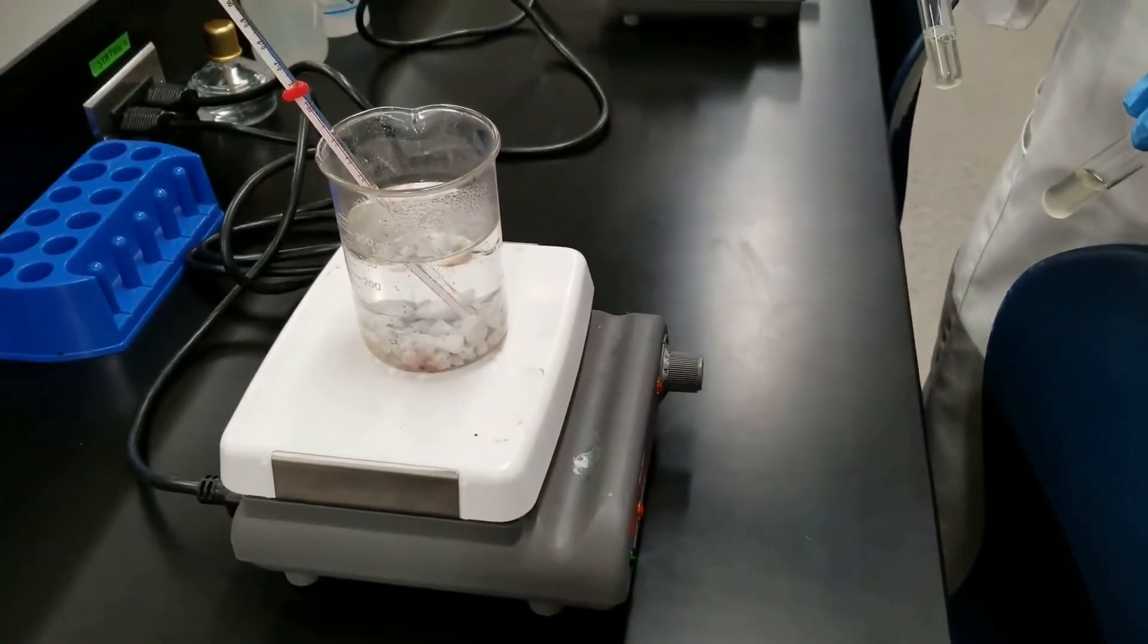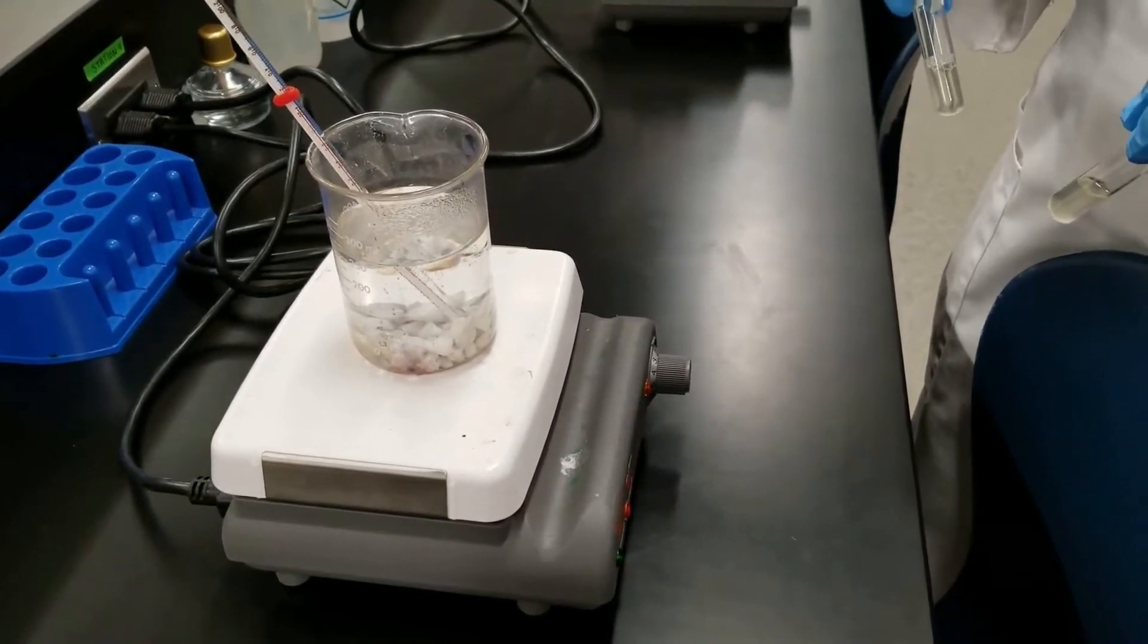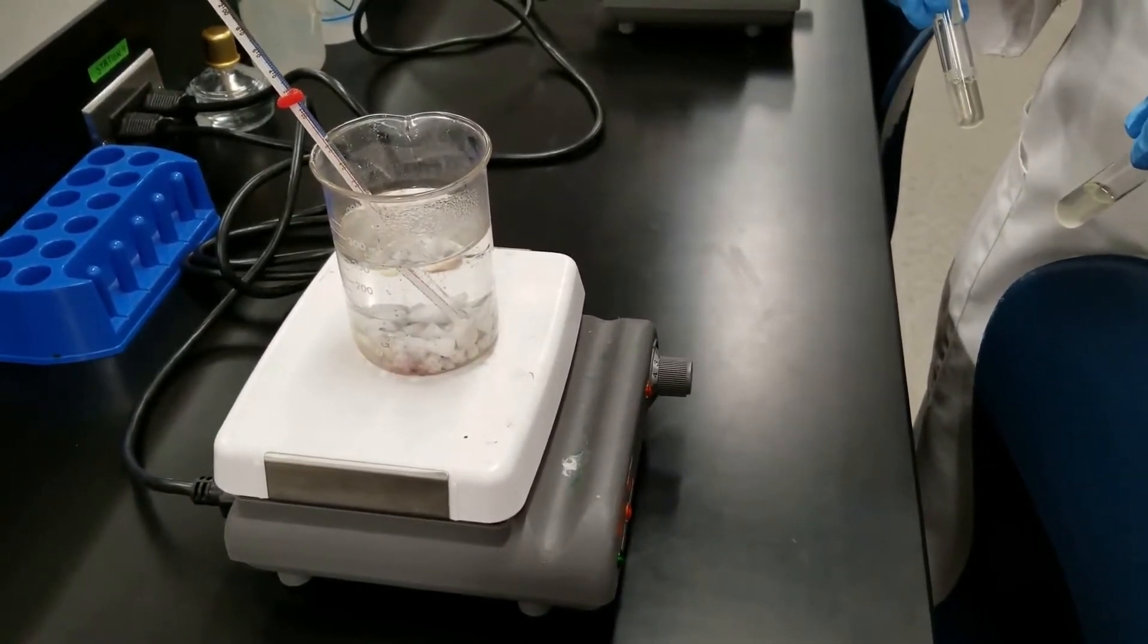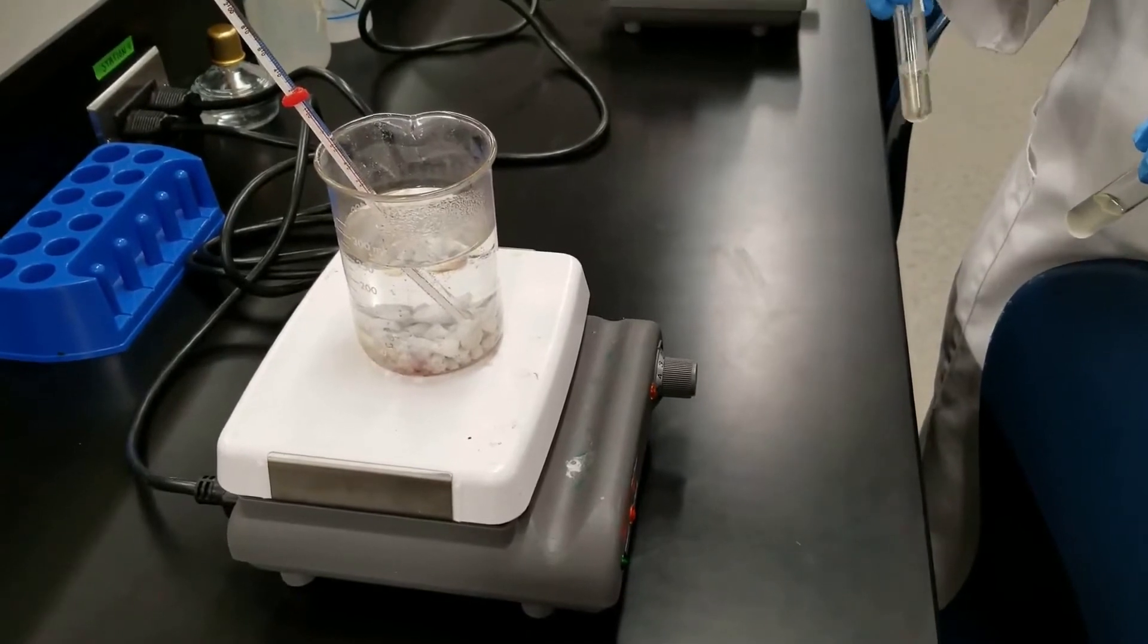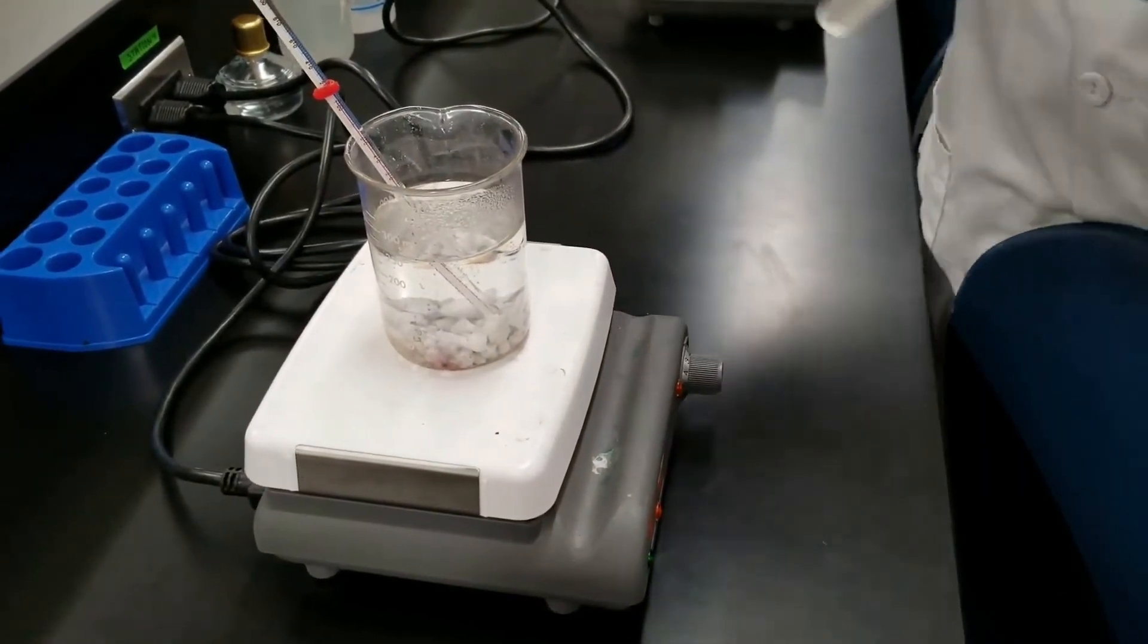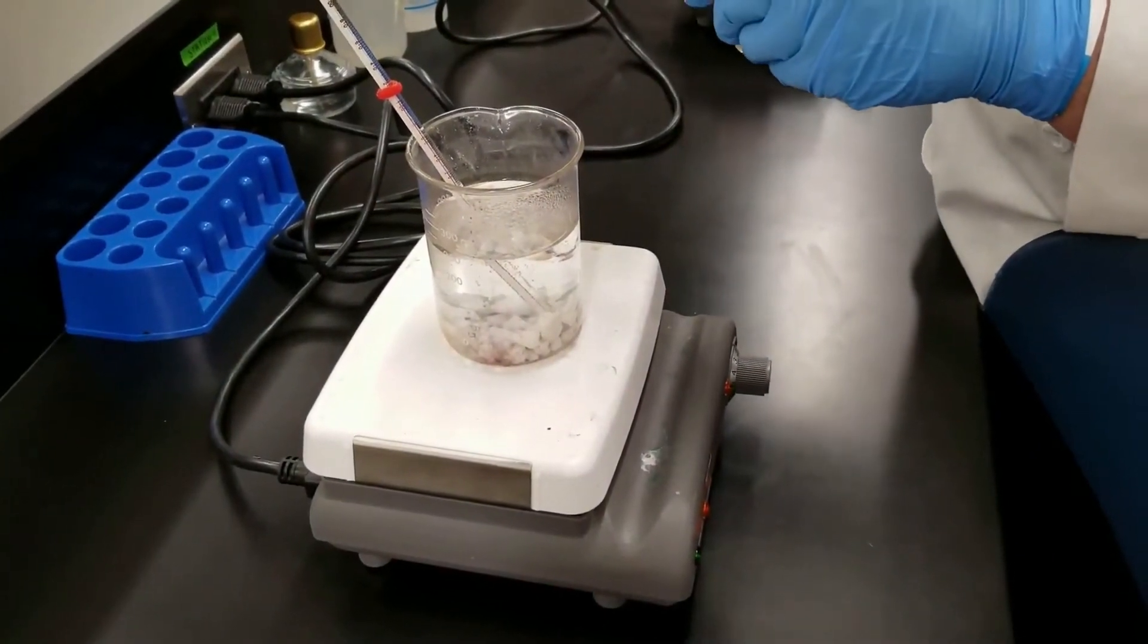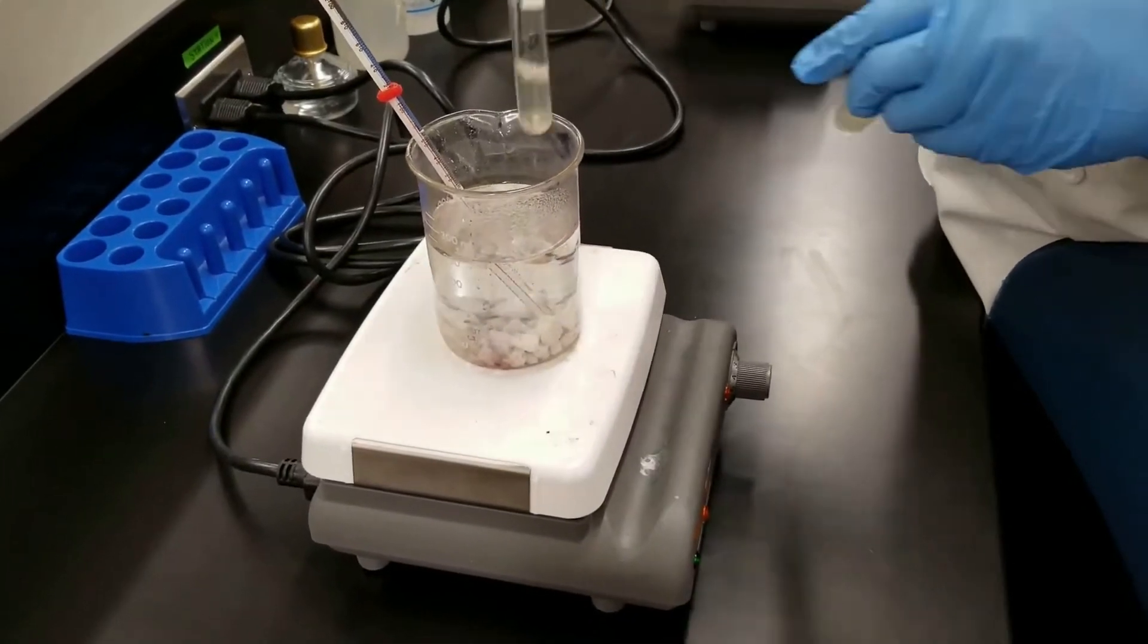The temperatures that we're testing, it's not where we're incubating them, it's the temperature that the organism is going to be exposed to for a certain period of time. So this water bath is set at 40 degrees Celsius. We're going to put the tubes in to make sure that it's not too loose, but not too tight so heat can't escape.